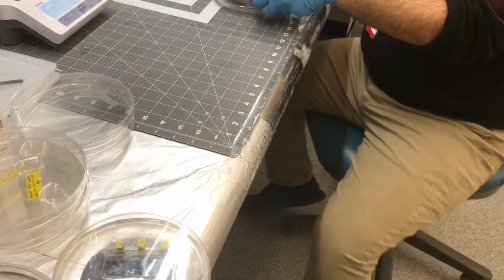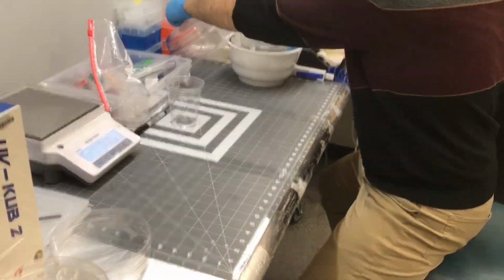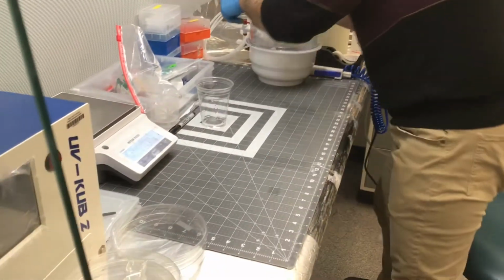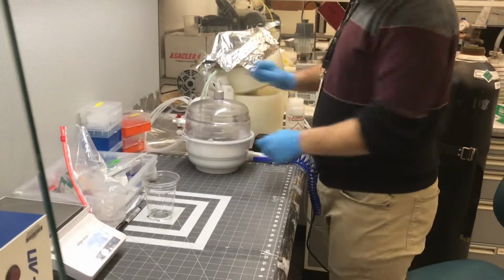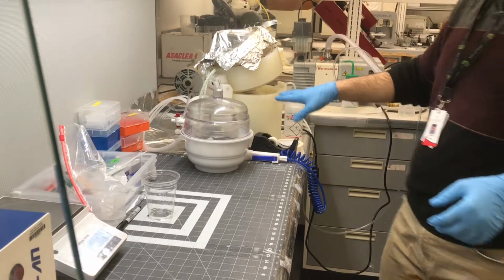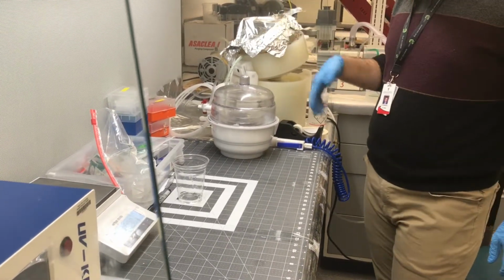By this approach, you put everything together. So this means you cover them with that lid, and then you put it again inside the vacuum to remove all the bubbles from the chip.